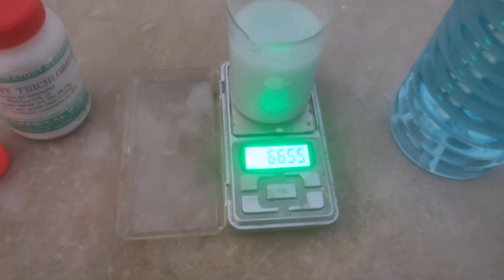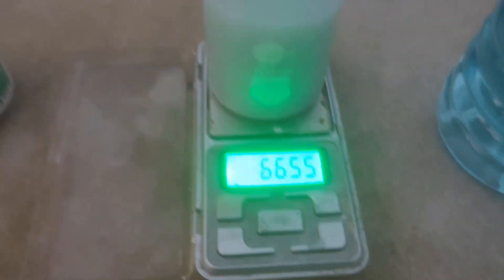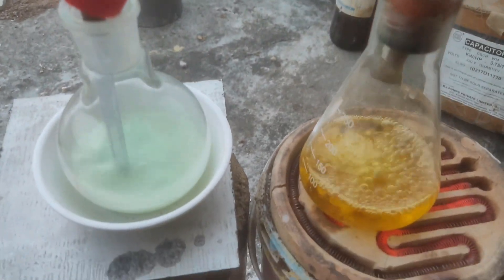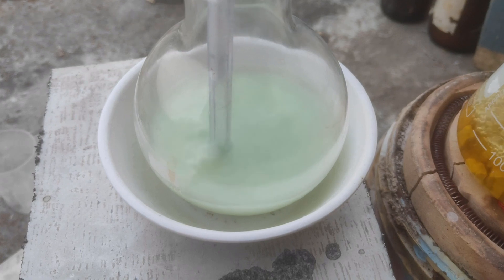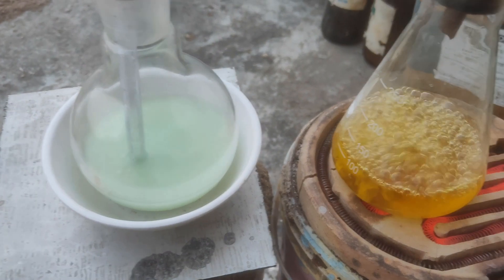Next, take the concentrated tin tetrachloride pentahydrate solution and add about 80% by weight of alcohol — either methanol or ethanol — based on the predicted amount of tin tetrachloride produced. A dopant of 10% by weight with respect to tin(IV) chloride is added; this dopant can be cerium or antimony chloride. Finally, more hydrochloric acid vapor is bubbled through the ethanolic or methanolic plating solution until it is very strongly acidic — theoretically reaching a 20% methanolic or ethanolic HCl solution. After this, it is ready for use in the plating step.